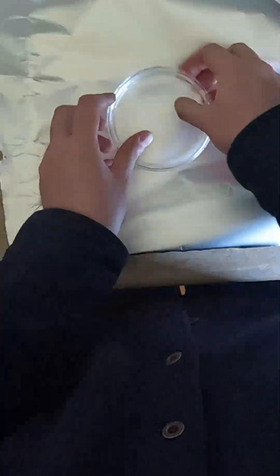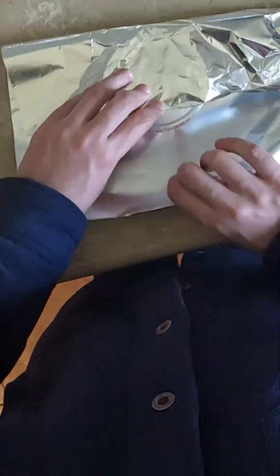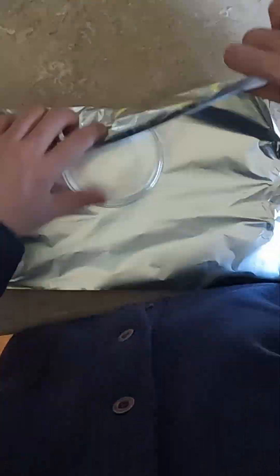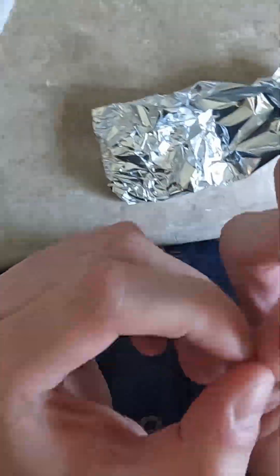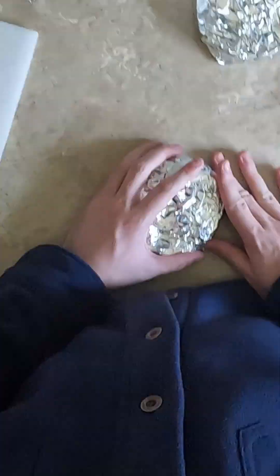You're then going to wrap all of your petri dishes in aluminum foil. You can do them in stacks of five or do them individually — it's dealer's choice here. Just make sure they're thoroughly sealed and cleaned before they go into the oven. You're also going to preheat the oven to 400 and put your dishes inside once they're done for two hours.